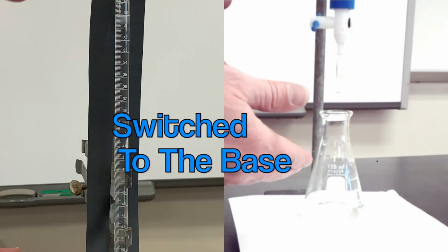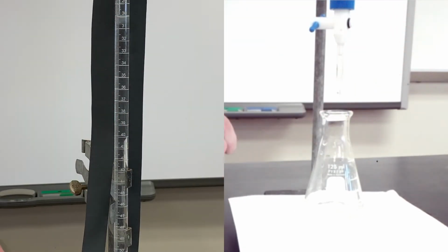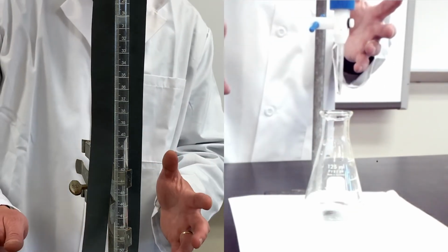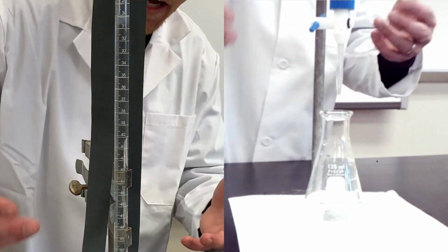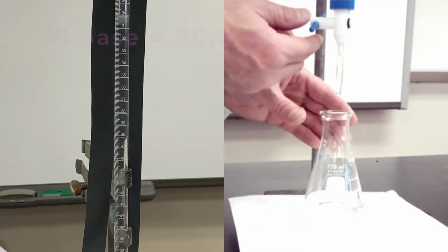All right, now I've got my base in place and we can see the volume there. Okay, so I'm gonna add my base, and since we went to 41.2, that puts us at about 11 milliliters. That means instead of adding 15 milliliters of base this time, I'm gonna try and add about 10 milliliters of our base, all right? Last trial, let's titrate.